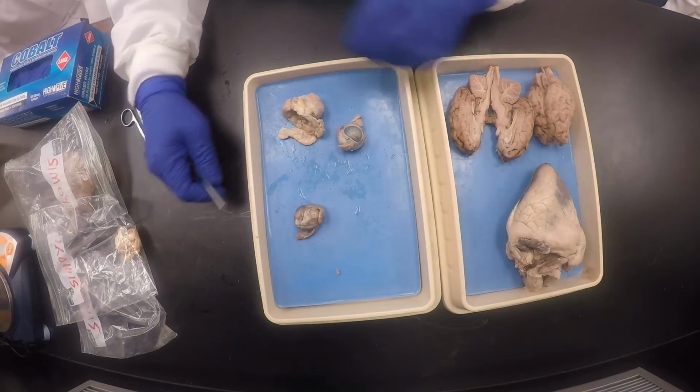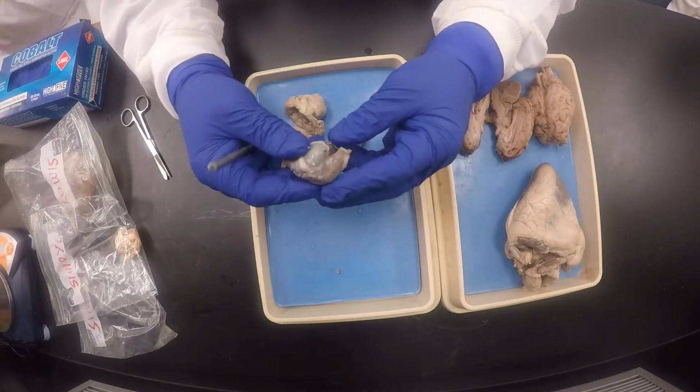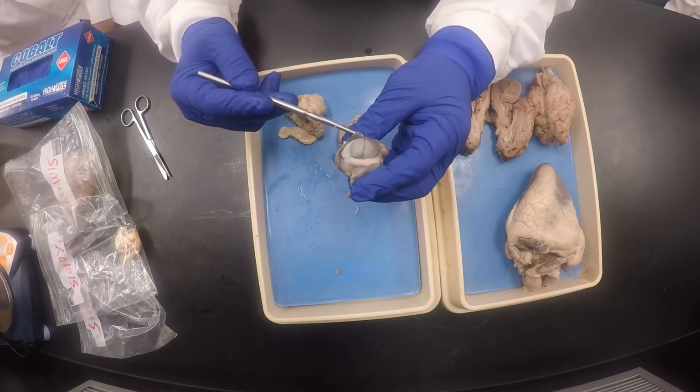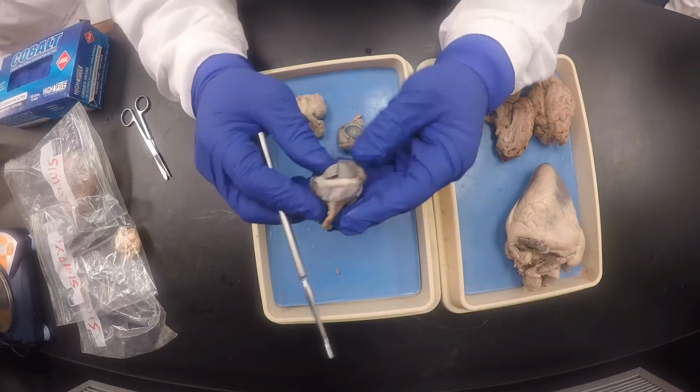Friends, we're doing the eye. The eye. Okay, the last one. Yay! Isn't that nice, my excellent friends? So I'm gonna do the one that I cut and processed, both the scleral and the corneal incisions. Okay, so there is the eye.